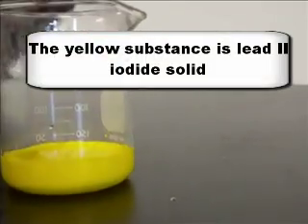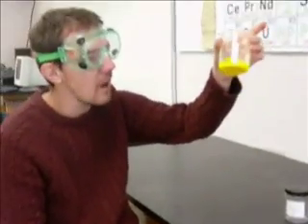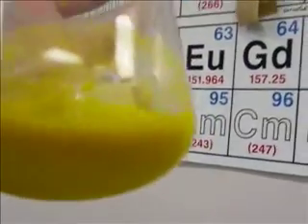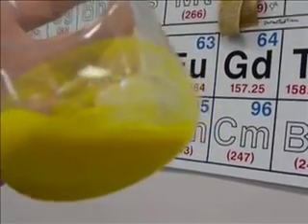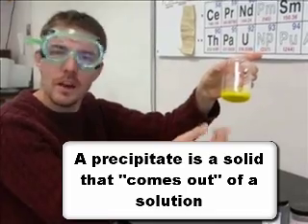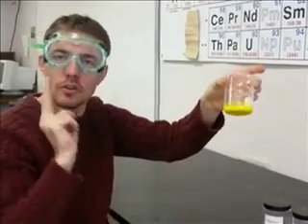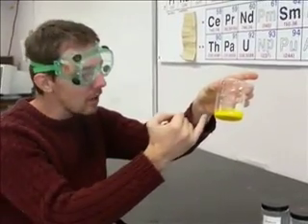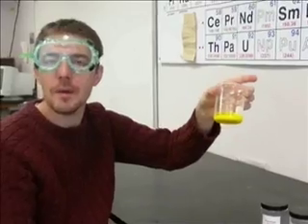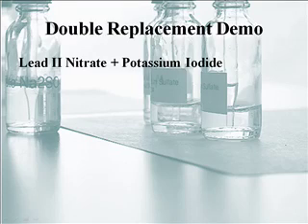Whoa! Our two clear and colorless liquids formed a yellow solid. If you get real close, you can see that it's a solid that's formed. It didn't just turn into a yellow liquid. You can see chunks settling down to the bottom. We call that a precipitate. Don't confuse that with precipitation, like rain coming down. This is a solid precipitate that comes out of the solution and settles to the bottom. Two ionic compounds in solution, mix them together, and you form a solid ionic compound that does not dissolve in water in a double replacement reaction.